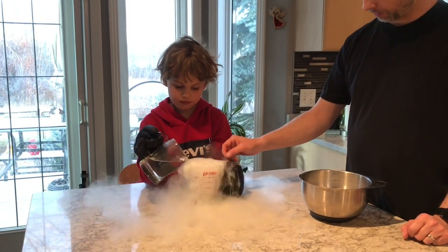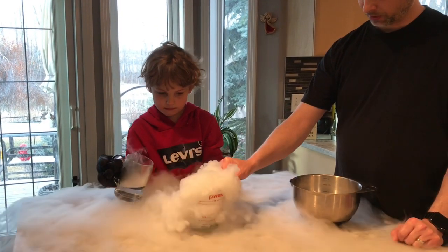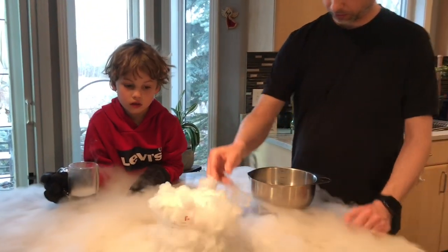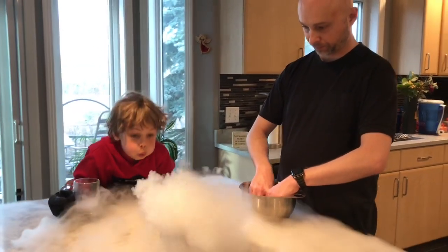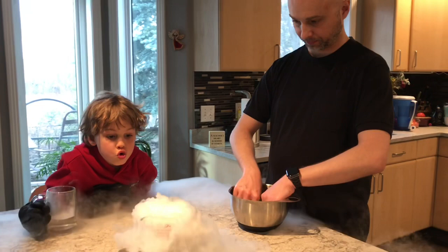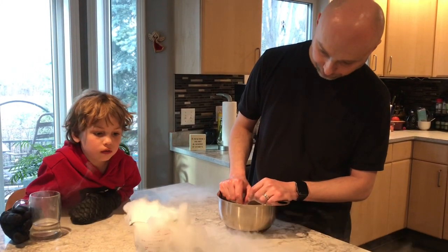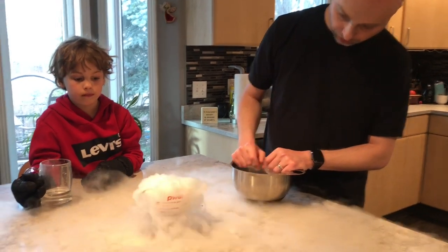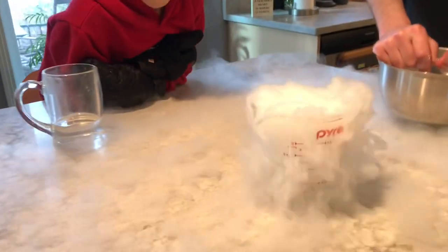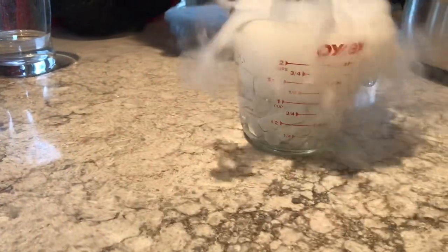So here we have our dry ice. Okay, that's good, thank you. We're just going to bring it to the middle of the table here. We're going to wait till it settles down a little bit. It's hard to see right now, but if you look down there, it looks like what boiling water would look like. Okay, thank you, Professor Marcus. It looks like boiling water.